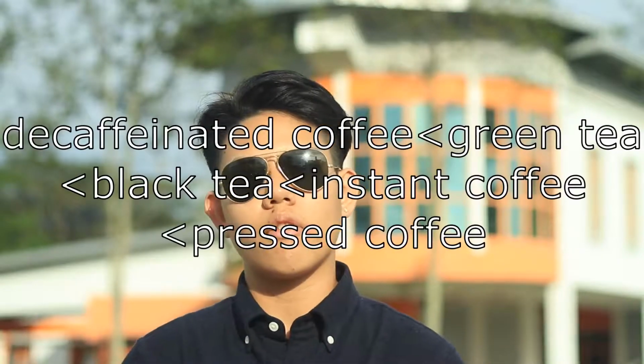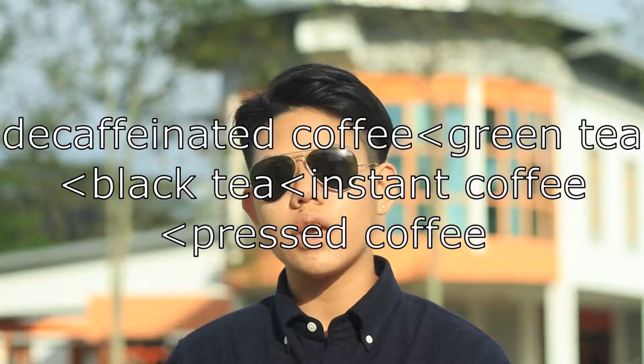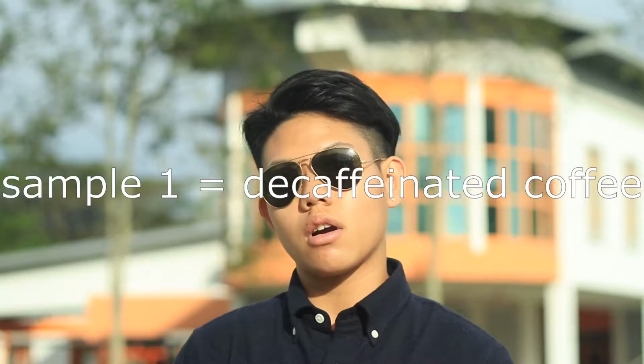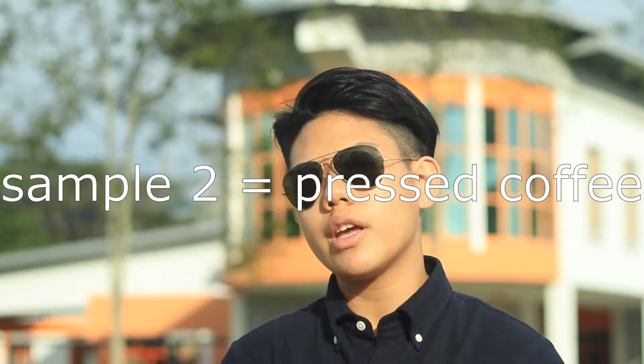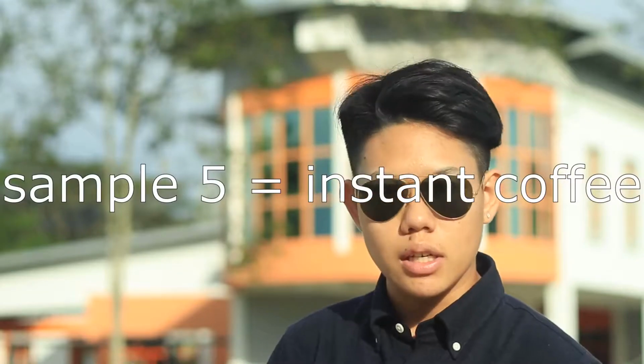first is decaffeinated coffee, second is green tea, third is black tea, fourth is instant coffee, and last is pressed coffee. And according to the research that we have done, based on the concentrations we obtained from our results, sample 1 is decaffeinated coffee as it has the lowest concentration, sample 2 is pressed coffee as it has the highest concentration among all of them, sample 3 is green tea, sample 4 is black tea, and lastly, sample 5 is instant coffee. Throughout this experiment, we diluted the samples by 10 times and 50 times.